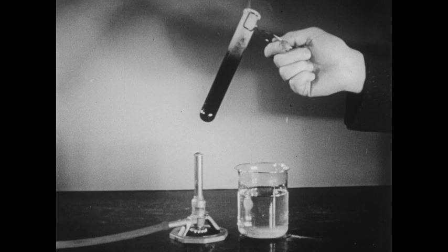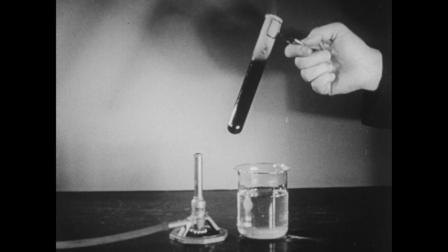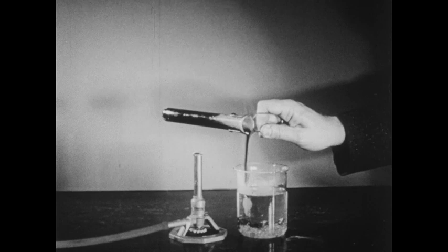The sulfur in this test tube has been heated to a very high temperature. In fact, the sulfur is now boiling. When sulfur is heated to this high temperature and then rapidly cooled, a third form of solid sulfur is formed. I'm going to cool this sulfur rapidly by pouring the very hot sulfur into this beaker of cold water.